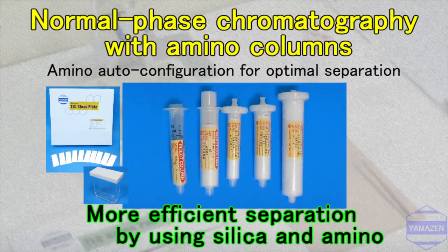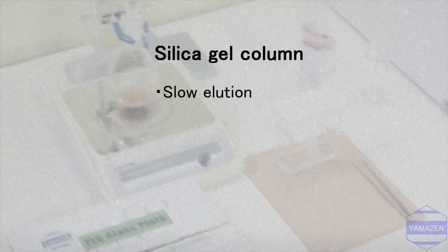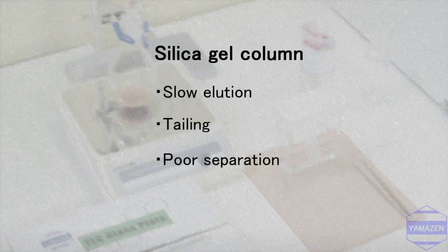When performing preparative column chromatography, using a silica gel column in a hexane ethyl acetate system is a commonly used method. Of course, a hexane ethyl acetate system with silica gel is not always the best method. When the sample has a high polarity, it may elute slowly, there may be tailing in the column, and overall, the separation will be poor.